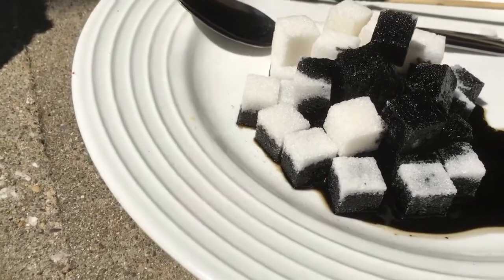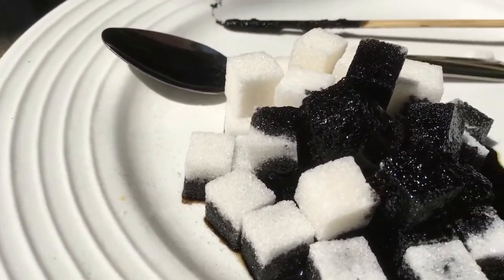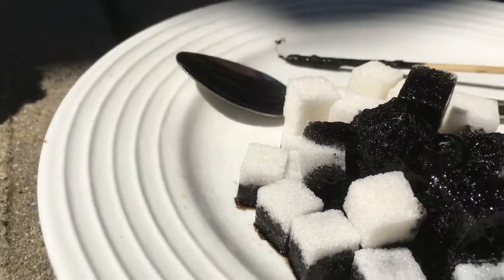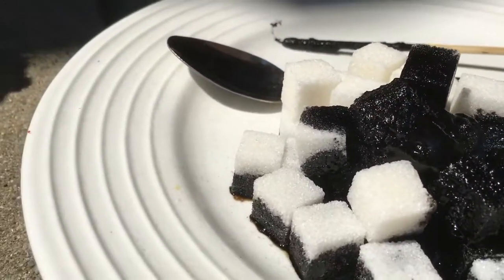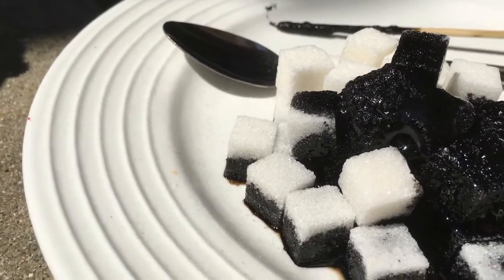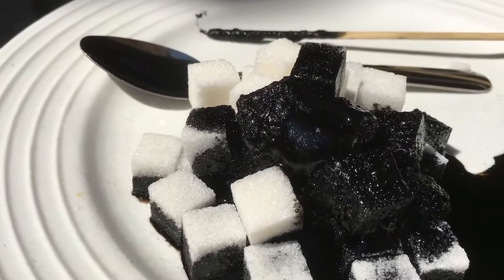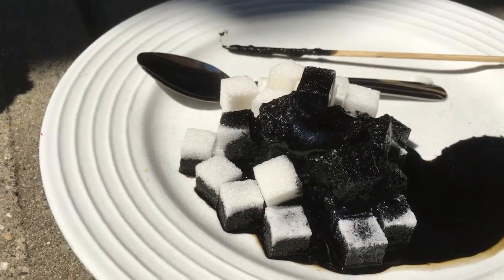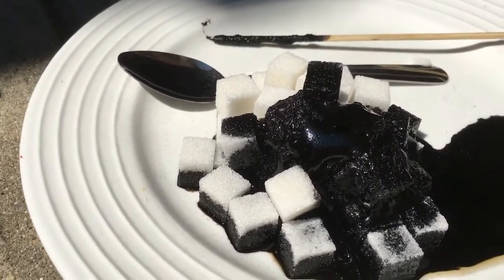Oh, I see one in the middle starting to move a little bit. You see that cube in the middle? Yeah, very slow. It's like bubbling up. It's releasing smoke. I see a little sulfur dioxide coming off of it, just a little bit. This is chemical potential energy becoming chemical kinetic energy. Exothermic, it's releasing heat. It's starting to move, but very slowly.